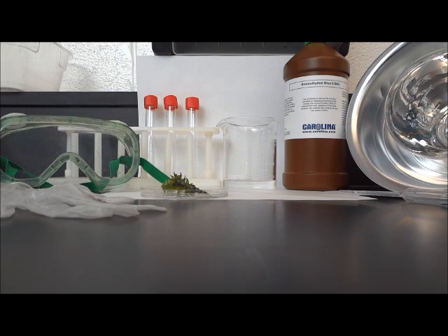Bromothymol blue solution can indicate the presence of carbon dioxide in water. When there is little or no carbon dioxide present, BTB will show a blue color. Depending on the amount of carbon dioxide, BTB will change to either green or yellow. A greenish yellow indicates that more carbon dioxide is present.